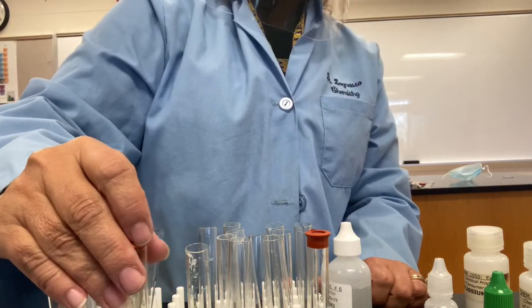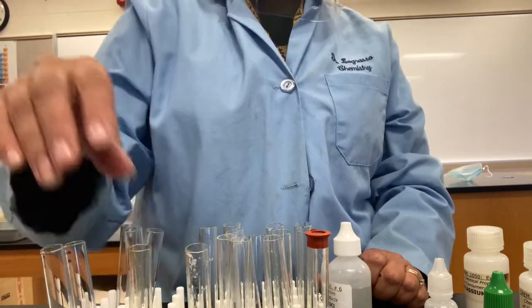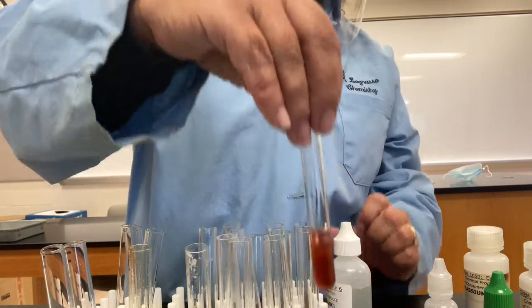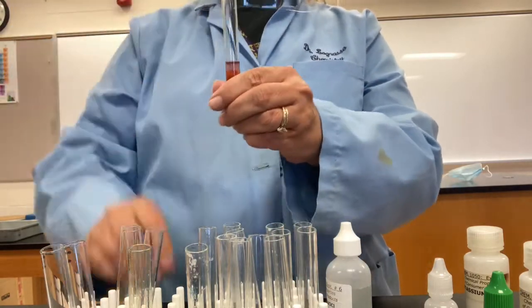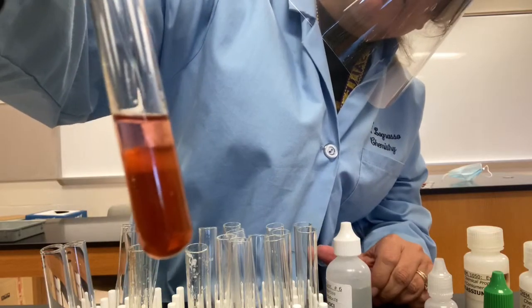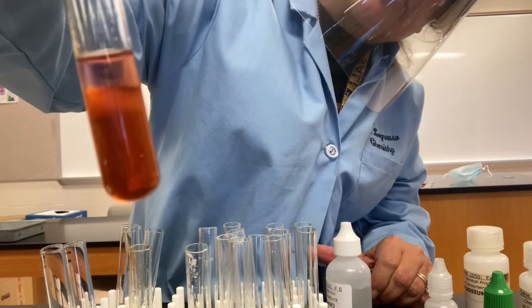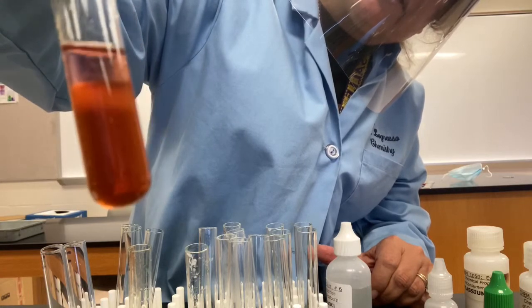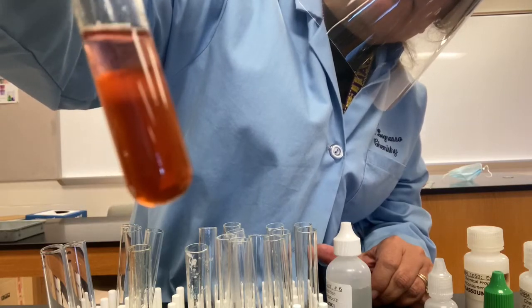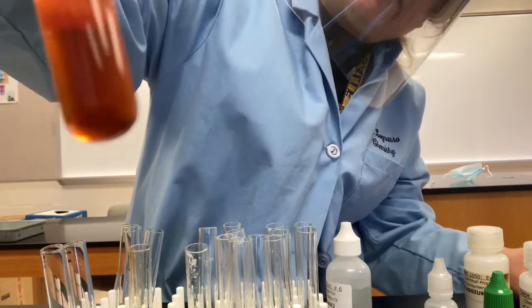So we'll have to let it sit there, and then we're going to take a look at it after some time has elapsed. And if we let some time elapse, this is like a baking show now, I'll just pull this out of the oven. And you can see that top layer, see how it's a little bit purple? That's the I2 that we extracted out. The I2 is there because it reacted with the hypochlorite ion, so that is a test for the presence of the hypochlorite ion. A little tricky test there, but in the end it works.